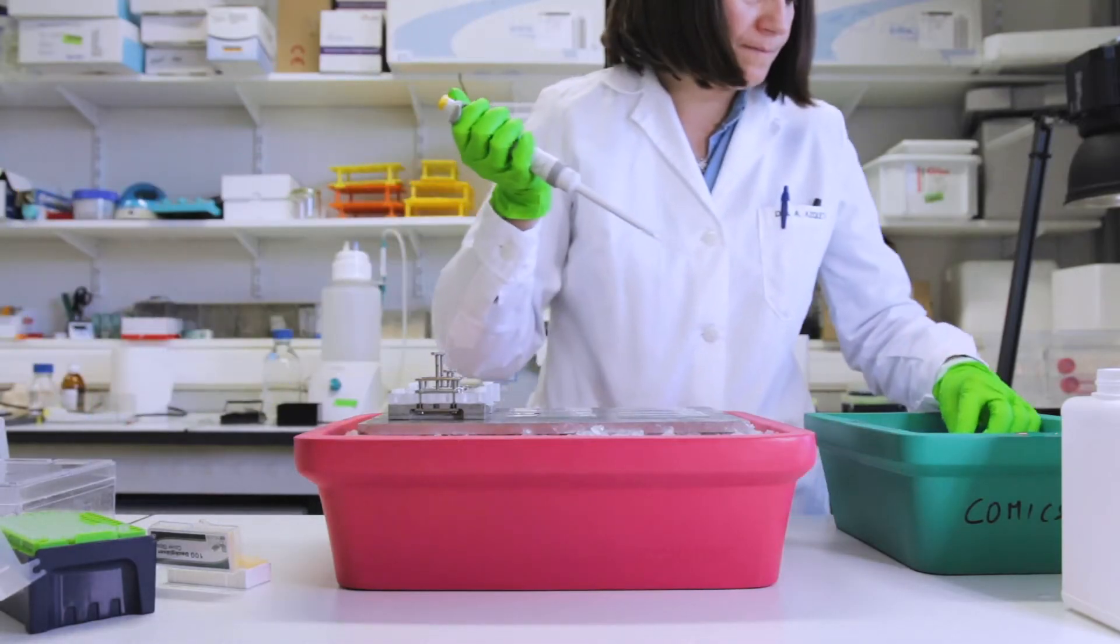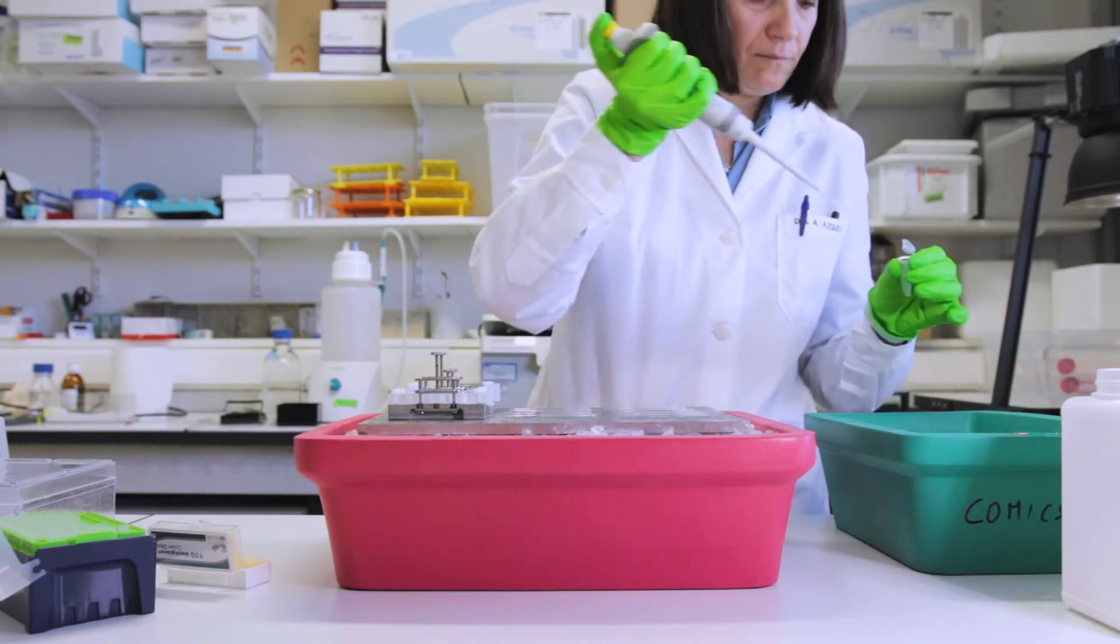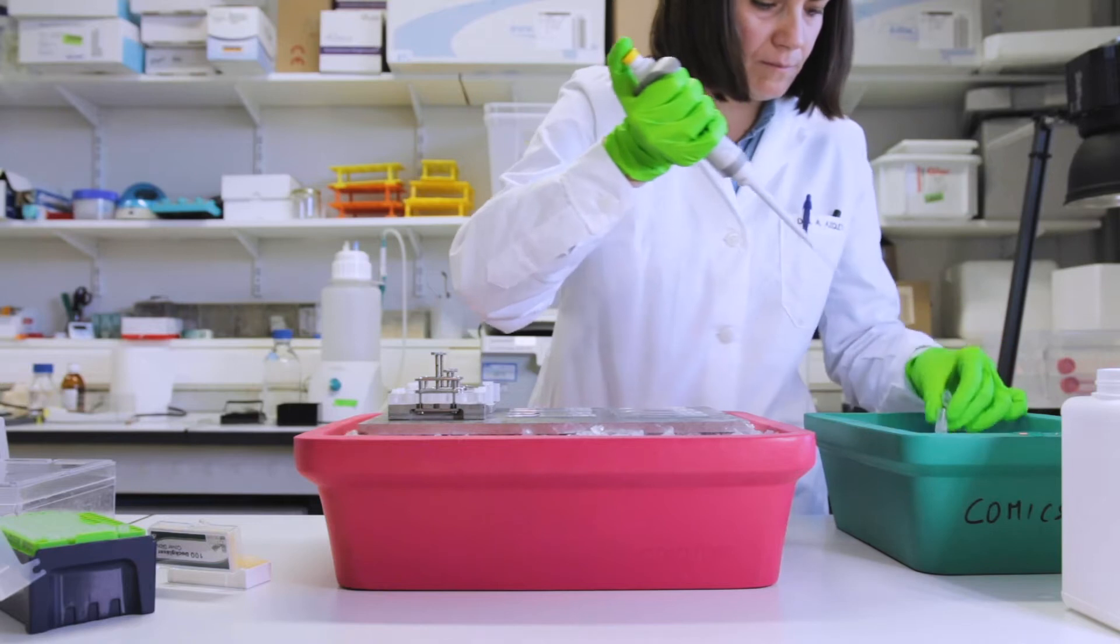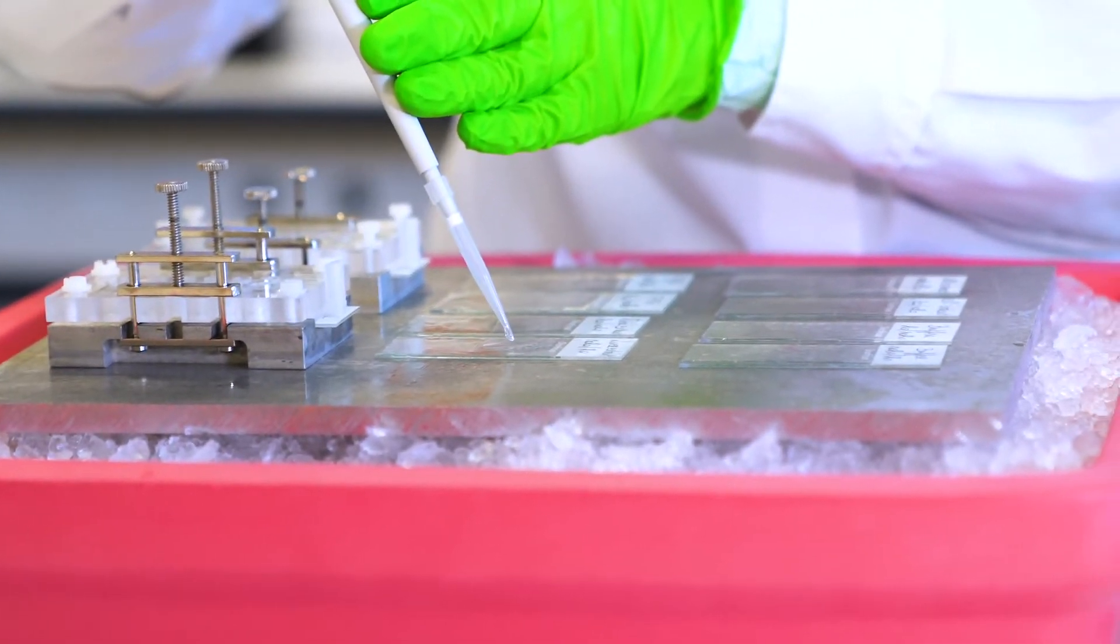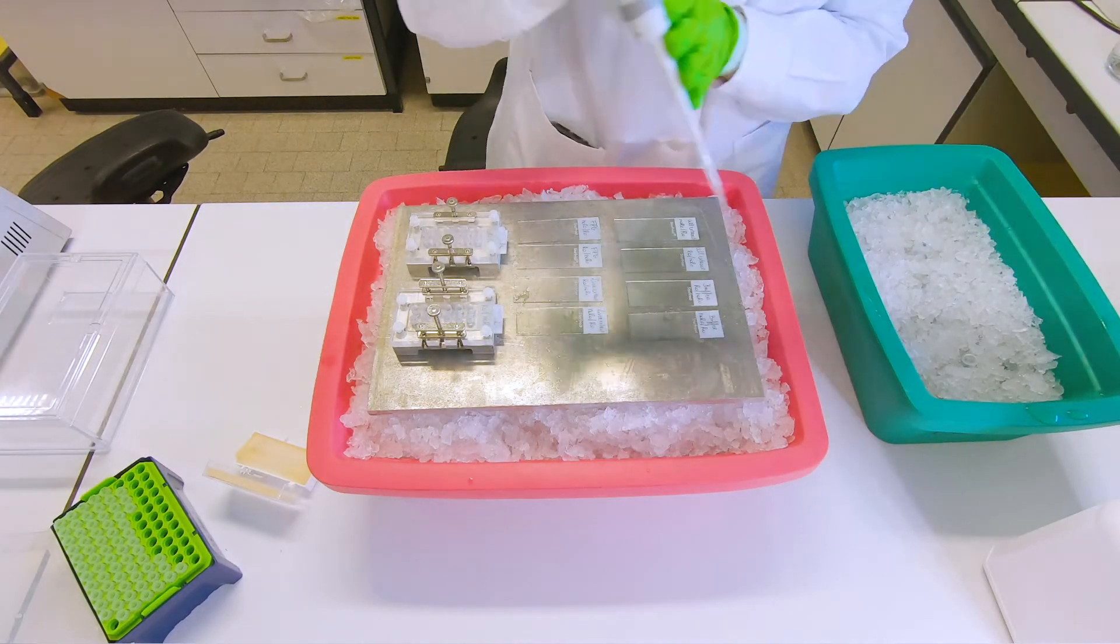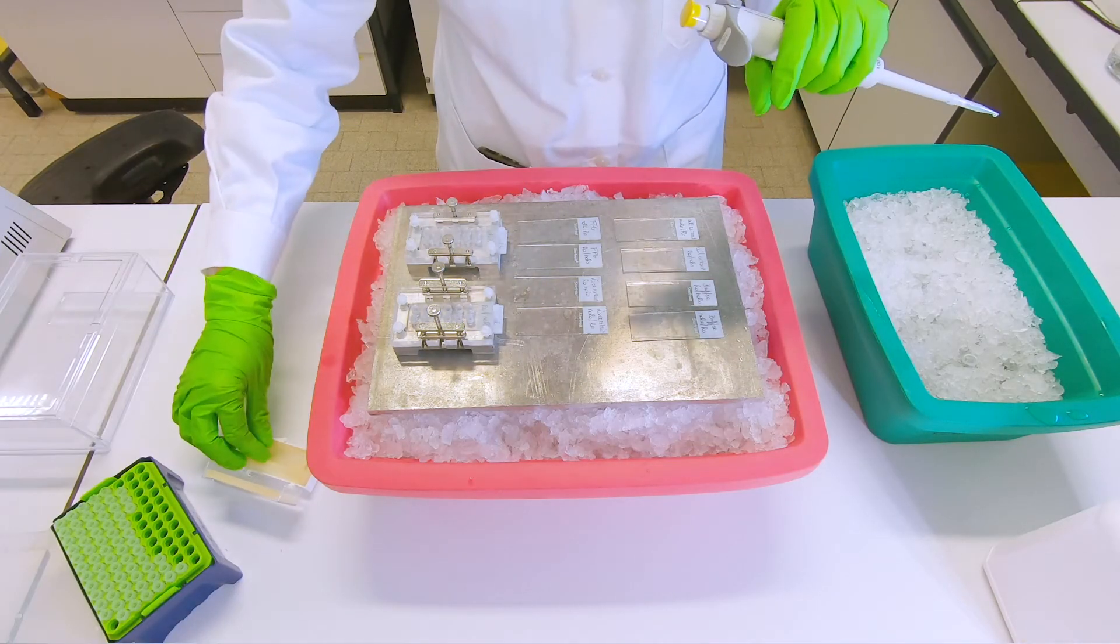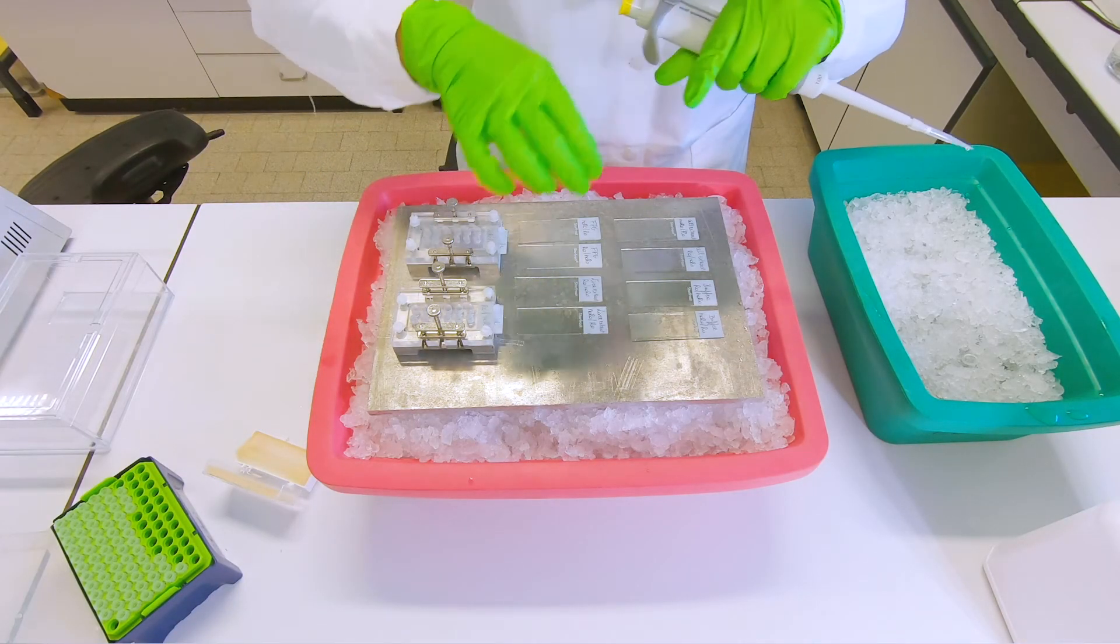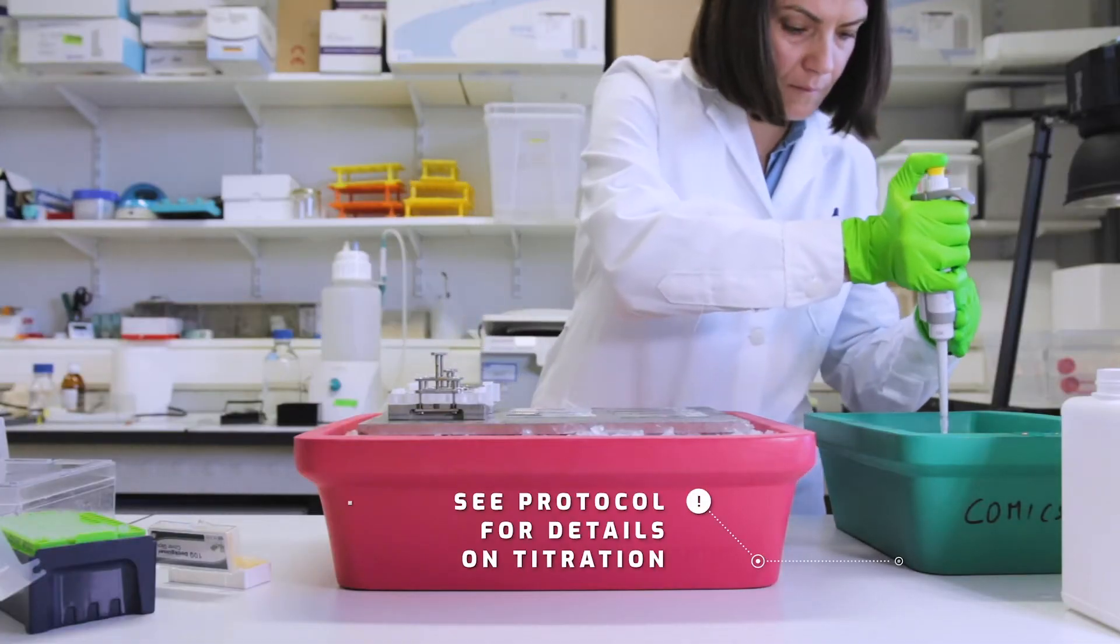Then next we are using a liver extract. What is important is that for each of these cell extracts or liver extracts you always titrate your protein concentrations.